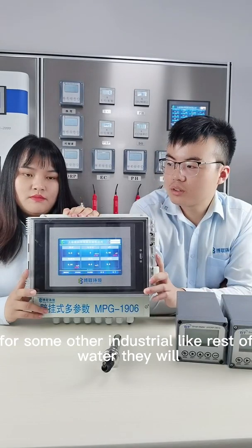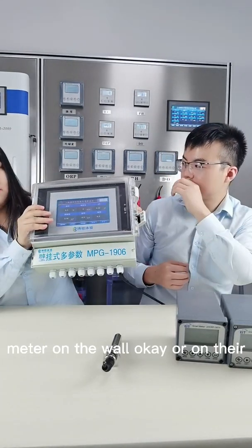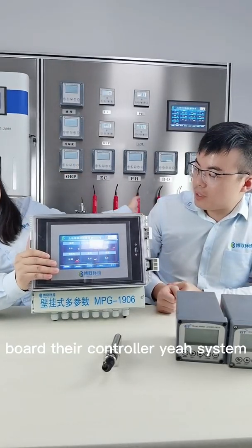But for some other industries like wastewater, they will hang this meter on the wall or on their board, their controller system.